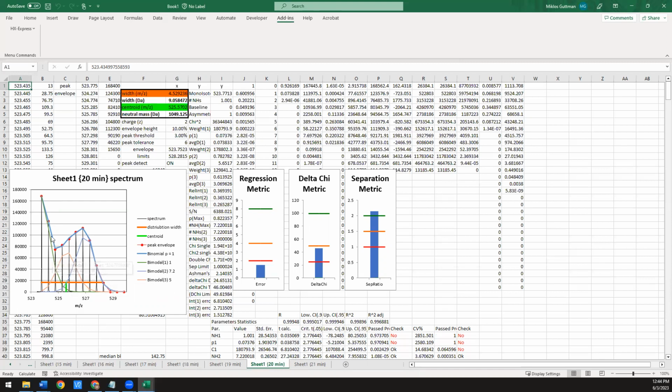Also from this, you may have this first population in green pretty well constrained, but these two are probably too close together and you don't really have enough to really say this relative intensity compared to this relative intensity with any kind of confidence. I mean, the numbers are all here, but I would be very cautious in how you interpret things like this. So that's the last thing I want to leave this data with. It is possible to do triple binomial fits. I would approach it with a very high degree of caution.